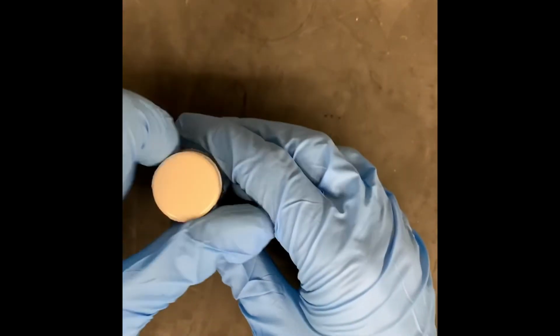So what we want to do is take our vial of unknown solution number 3 and take a TLC plate, and we draw the baseline across the bottom of the TLC plate. That's where we're actually going to deposit our unknown solution number 3 using a TLC spotter.